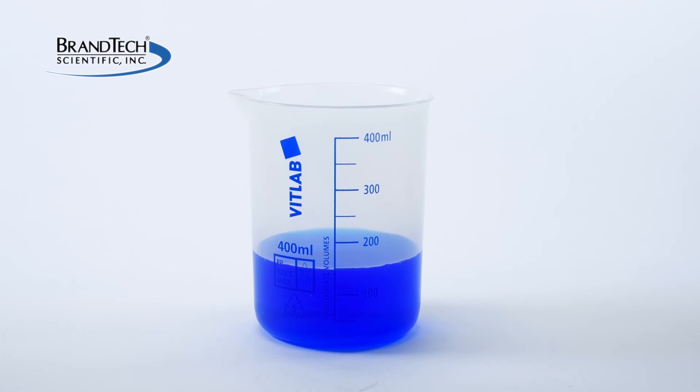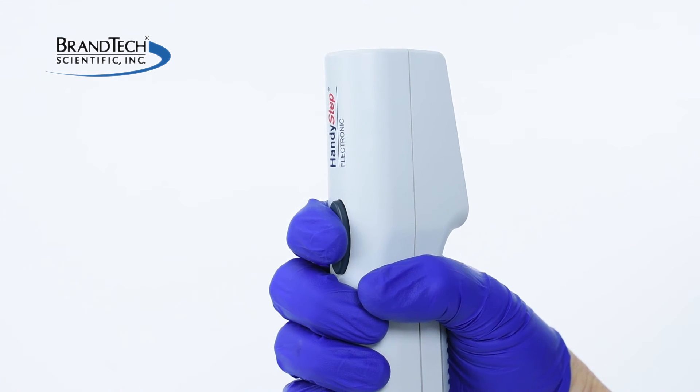Ensure that the orifice blockage is cleared and you have a suitable receptacle to collect the ejected liquid, then push the Step key to perform the reference run.